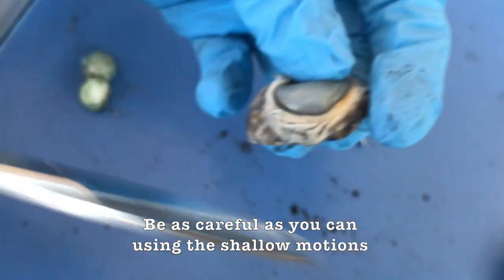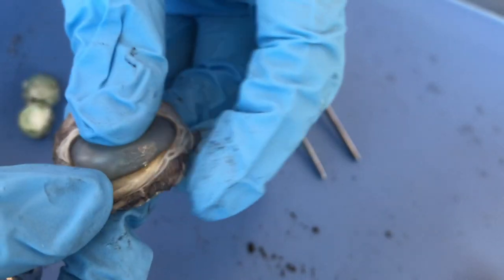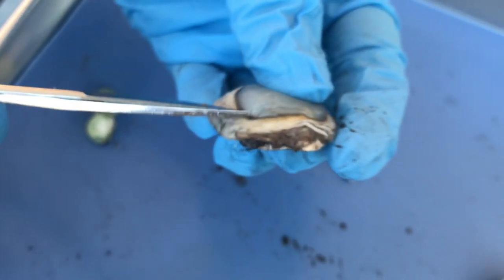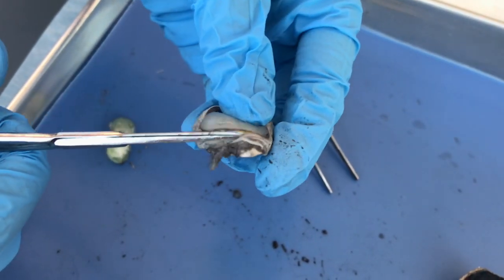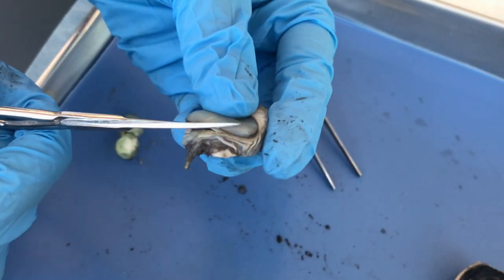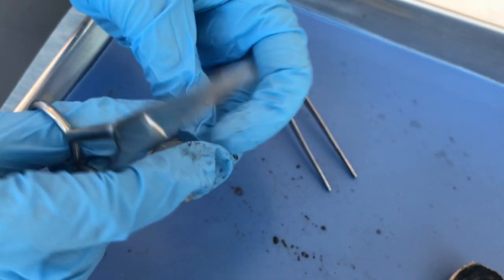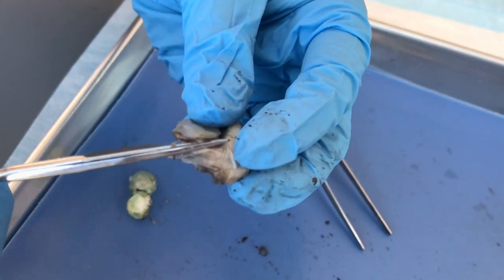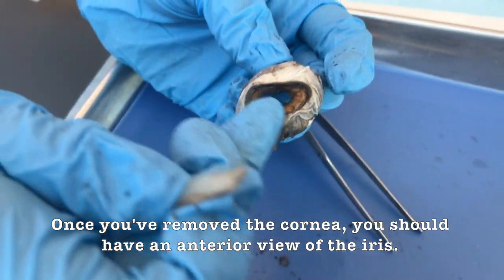Be as careful as you can using these shallow motions so that you are not damaging the iris. Once you have removed the cornea, you should have an anterior view of the iris.